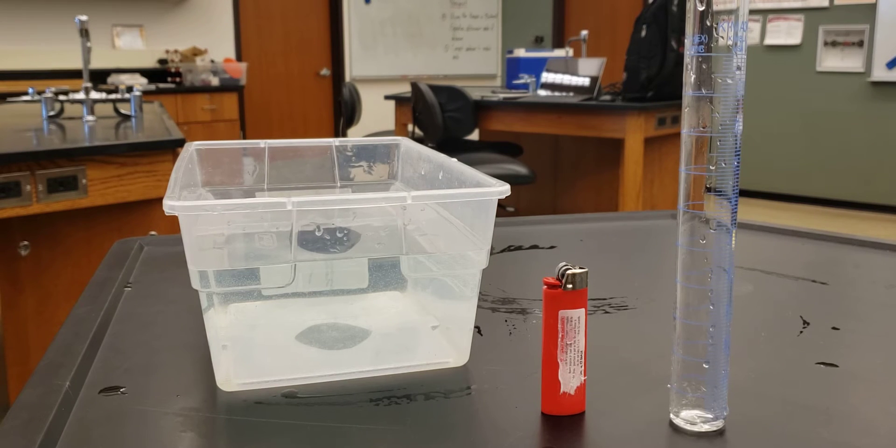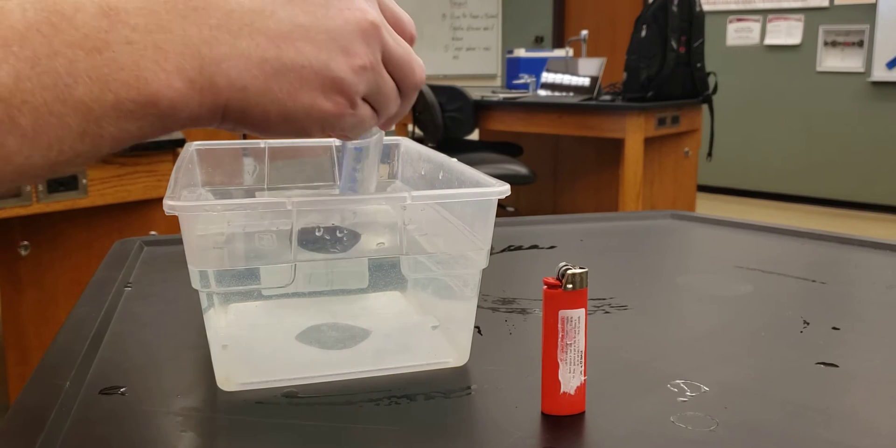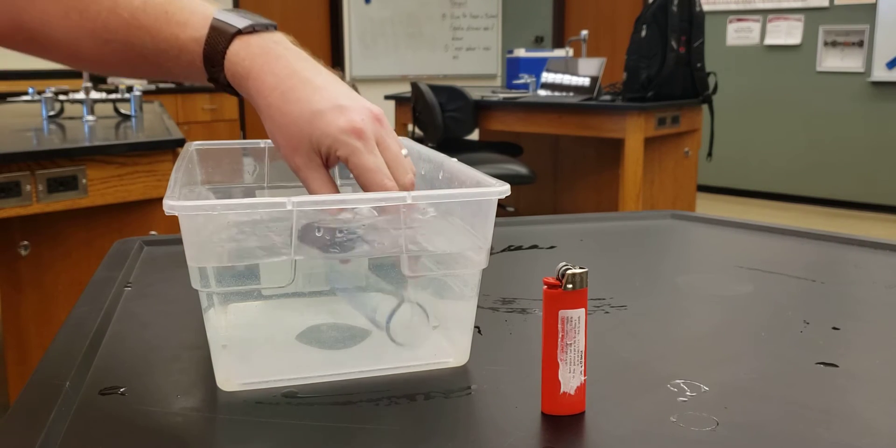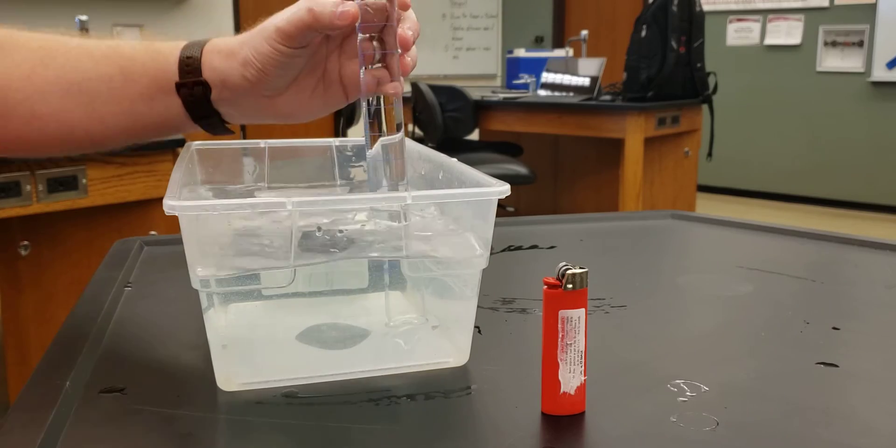Now to do this lab, we're going to do something that you probably did as a kid. We're going to submerge our graduated cylinder and it's going to lose all of its air, and then it's going to be completely filled with water.